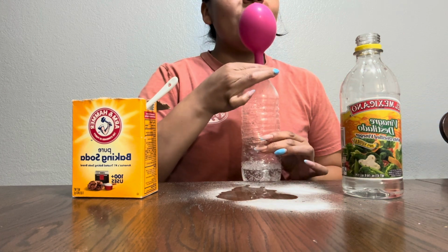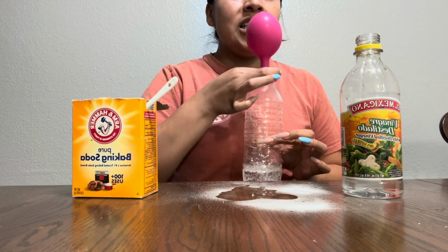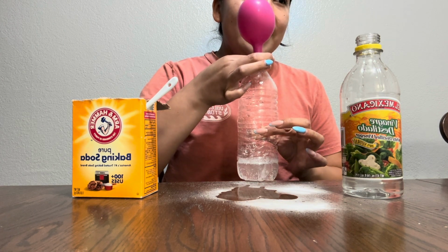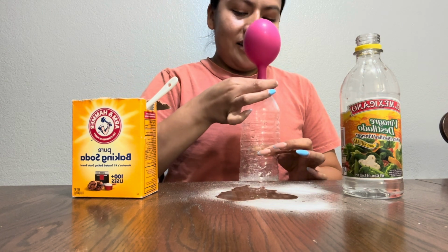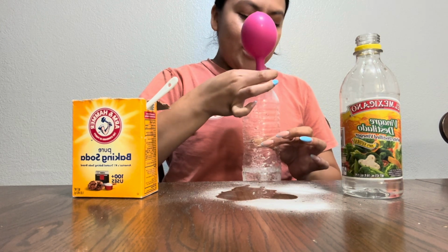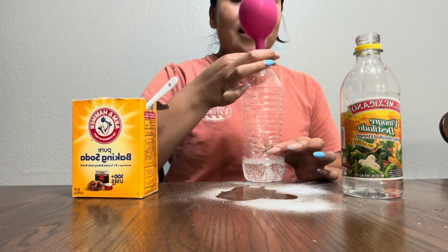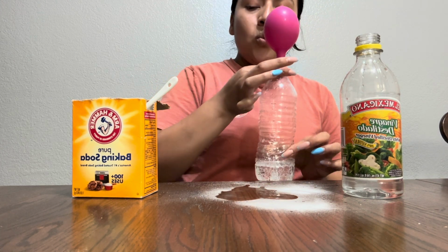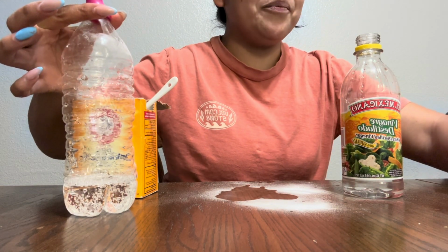So in conclusion, we see how the properties of substances change during a chemical reaction. This experiment demonstrates the concept of the reactants and an indicator that there is a chemical reaction. Do you guys see that? This is so cool. I hope you guys are enjoying this phenomenon right here. So we're going to put this aside, and we'll see at the end how much we get our balloon to inflate. But while we wait, we're going to go over our vocabulary one more time.